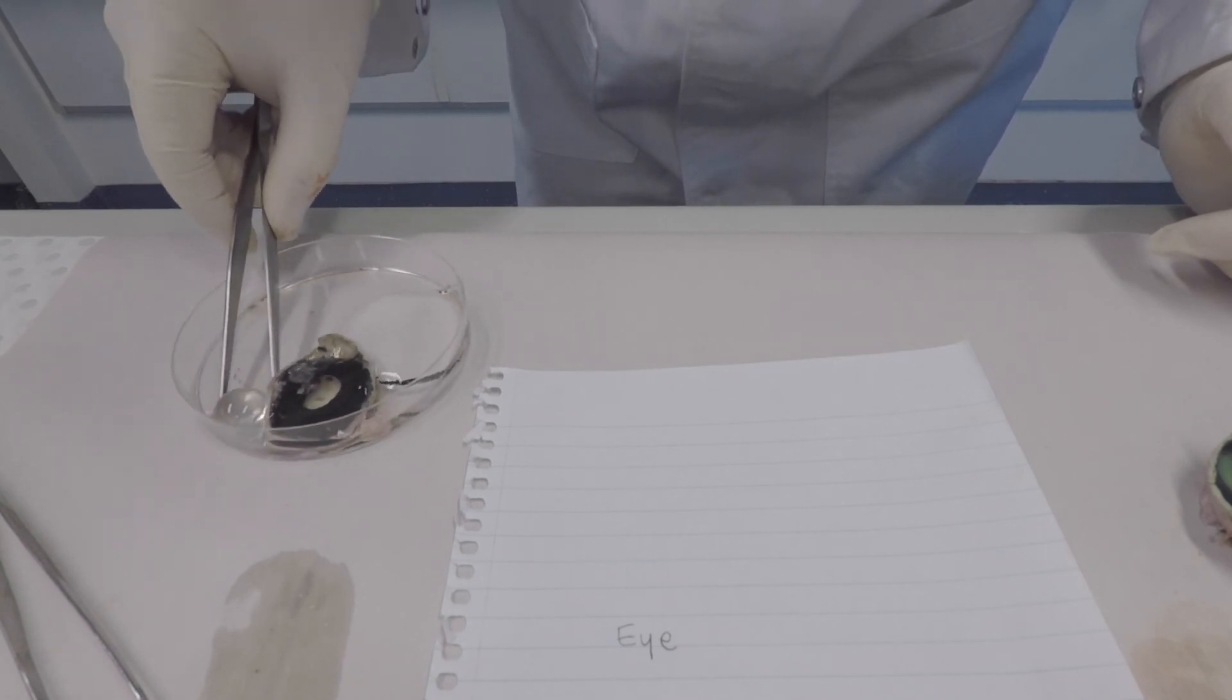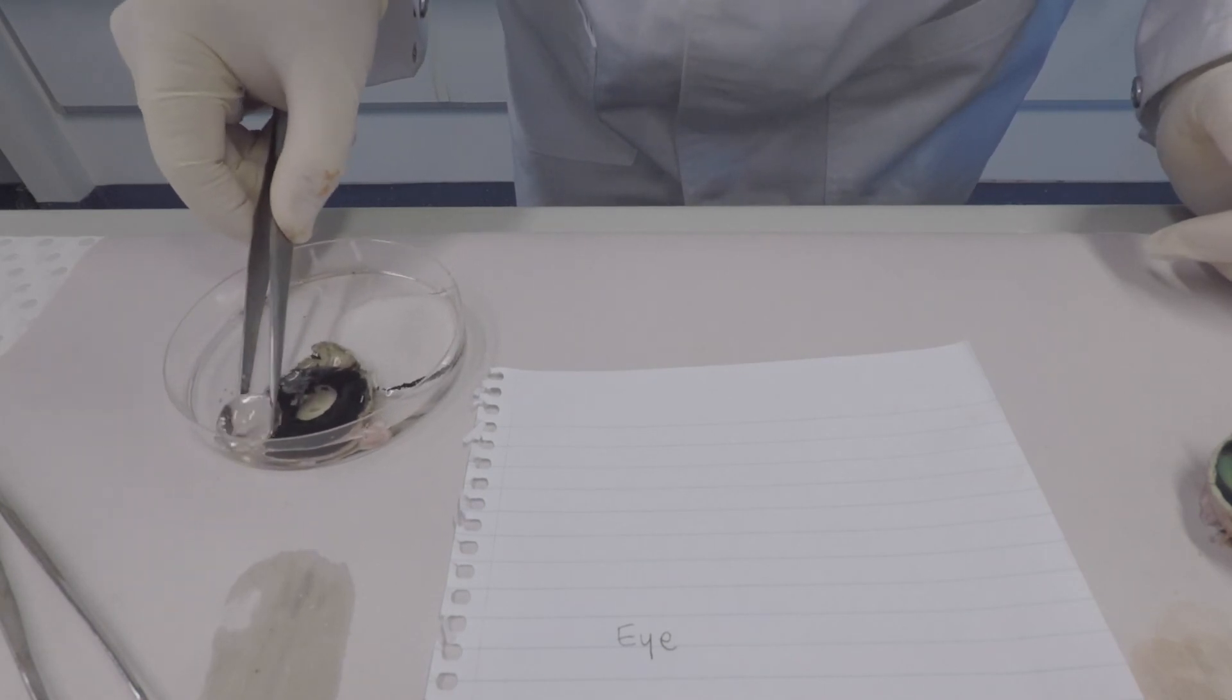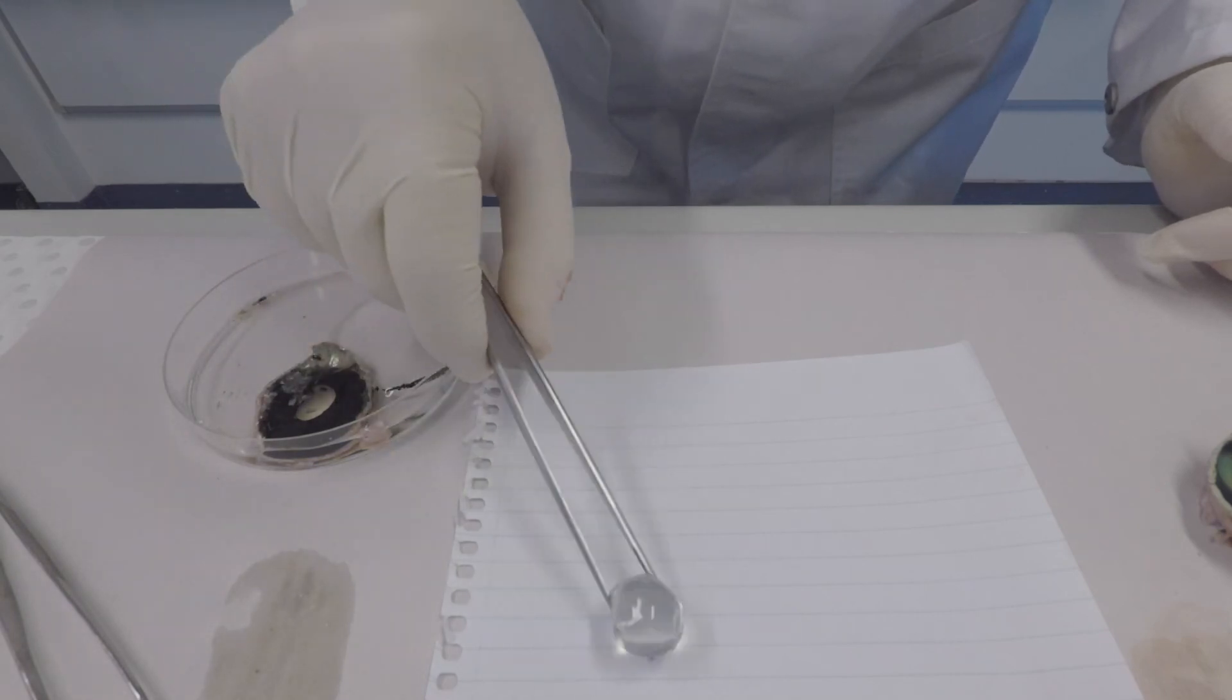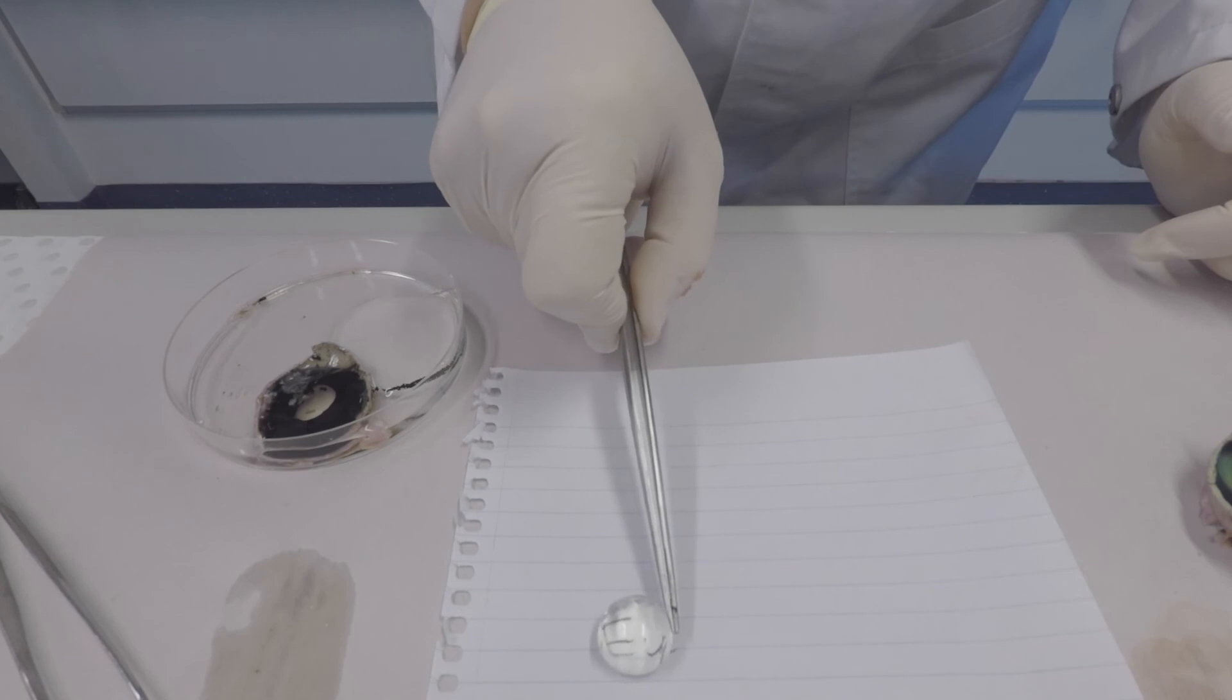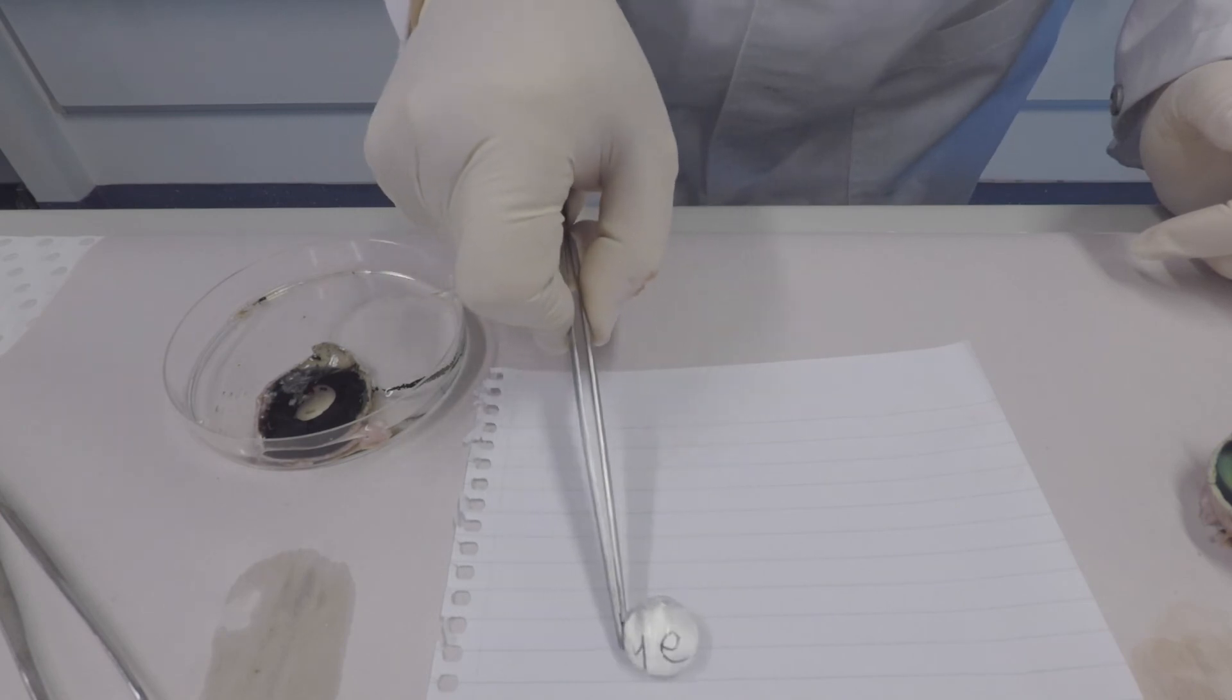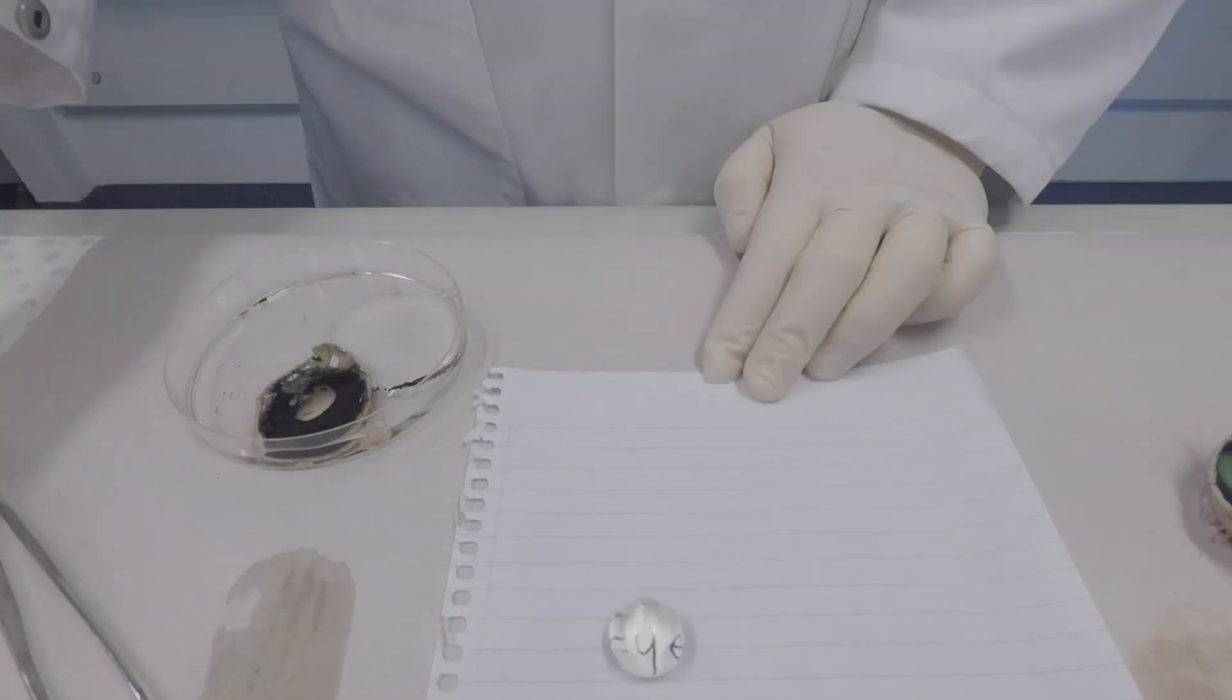Now we're going to look at the magnifying capacity of the lens. As we can see, the lens definitely has magnifying ability. It's greatly increased.